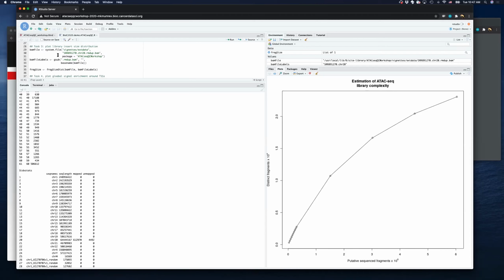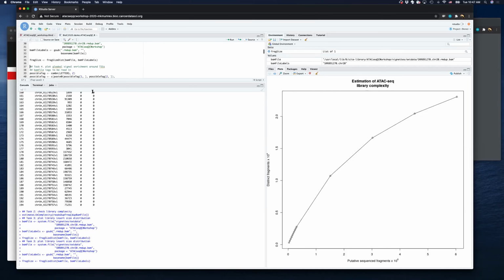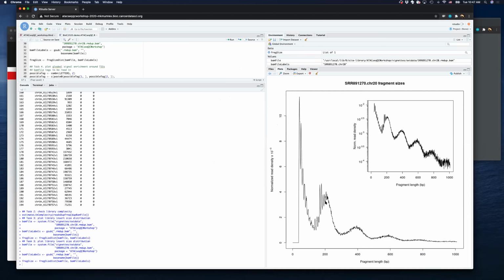And in part 3, this just gives the labels for your figure. When we run it, it will generate the fragment length distribution. As I have already told you, this is the nucleosome-free reads, this is mononucleosome, dinucleosome, trinucleosome. If we show it in log scale, it will show the distribution more clearly.